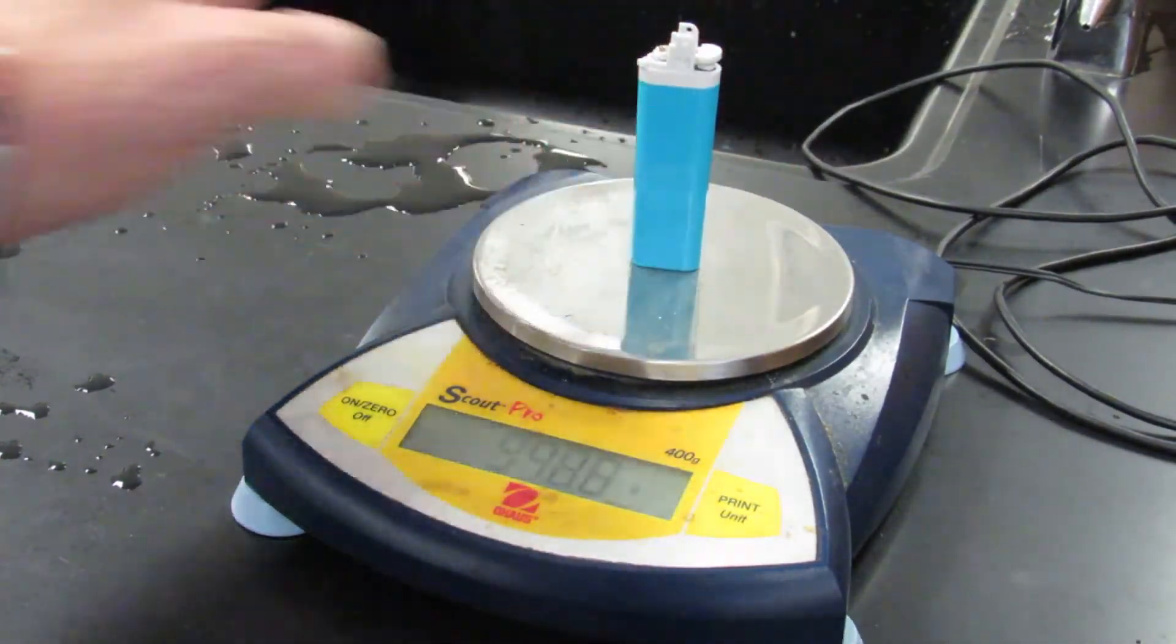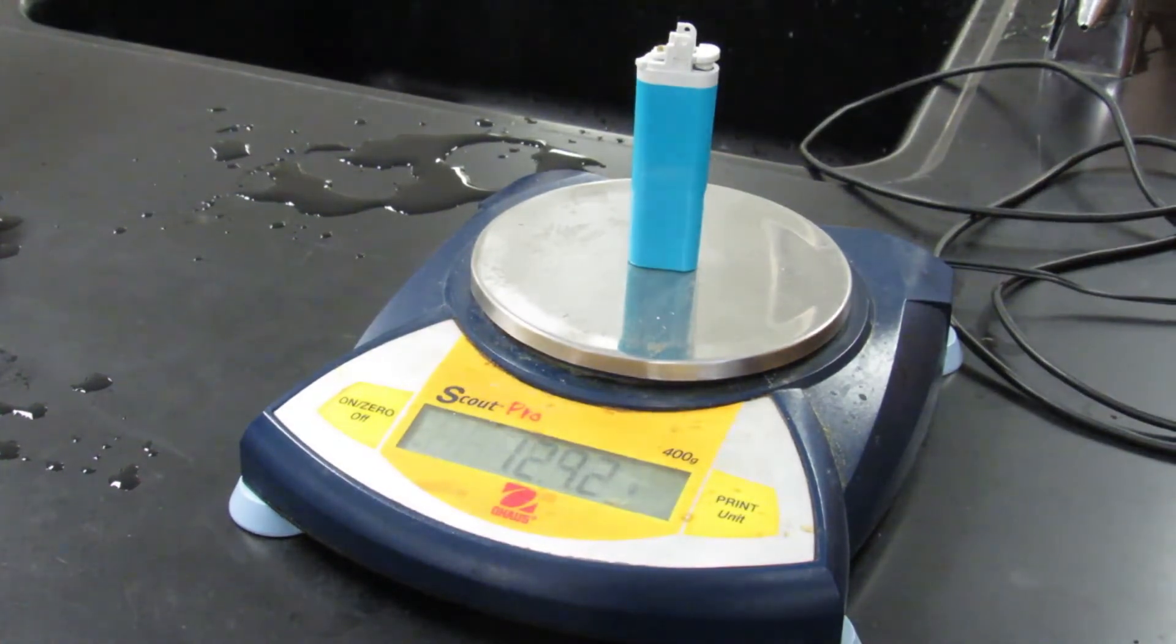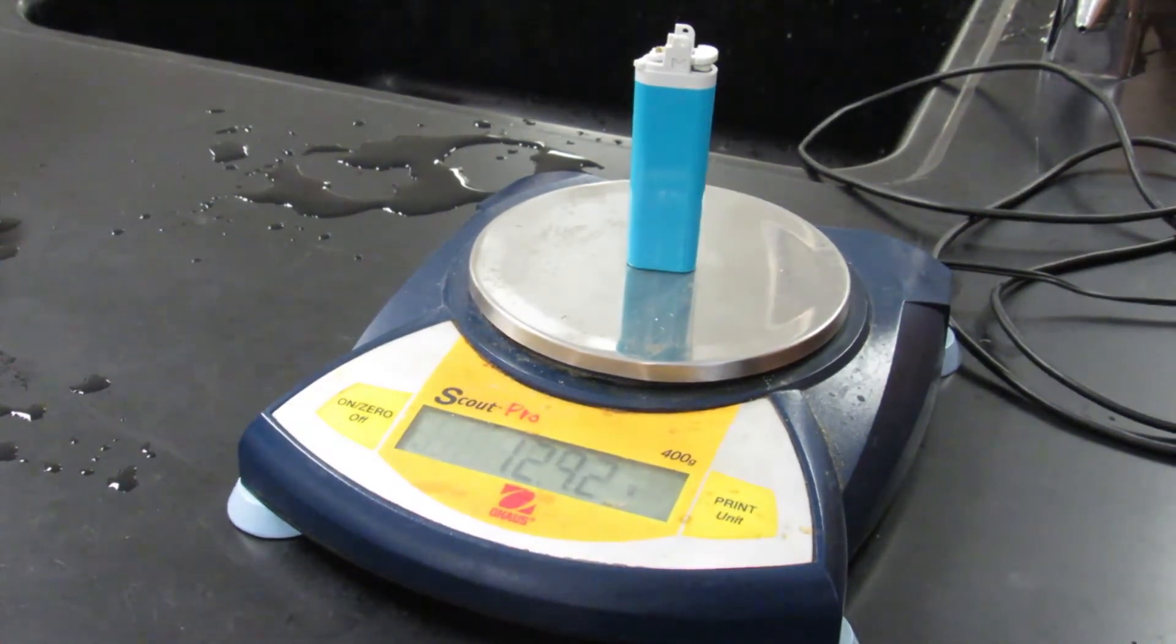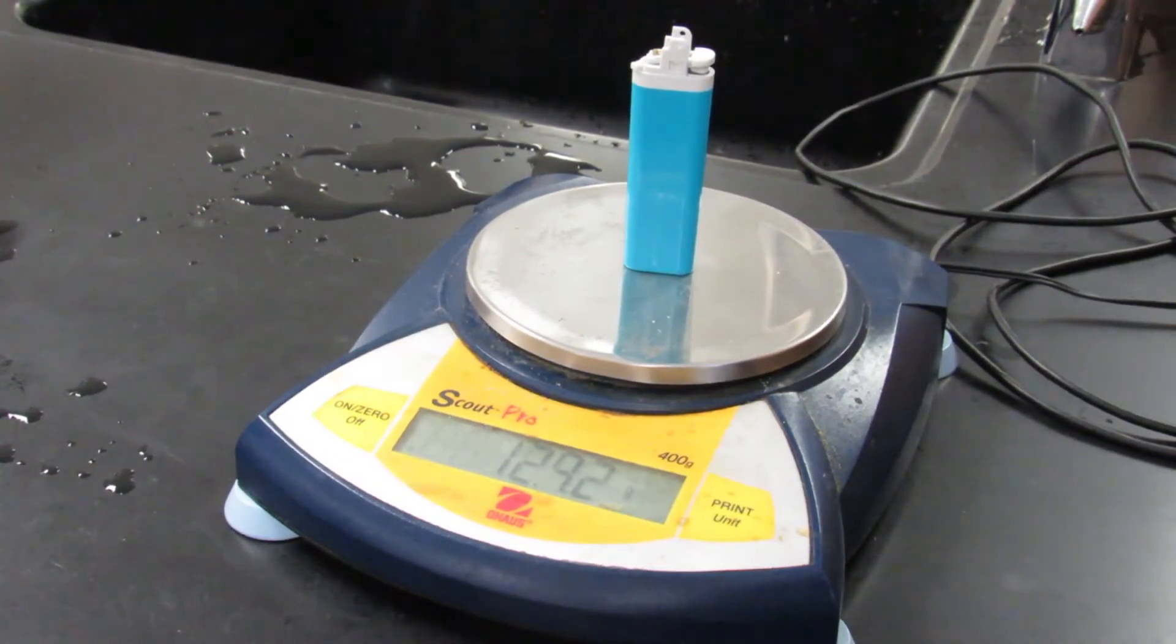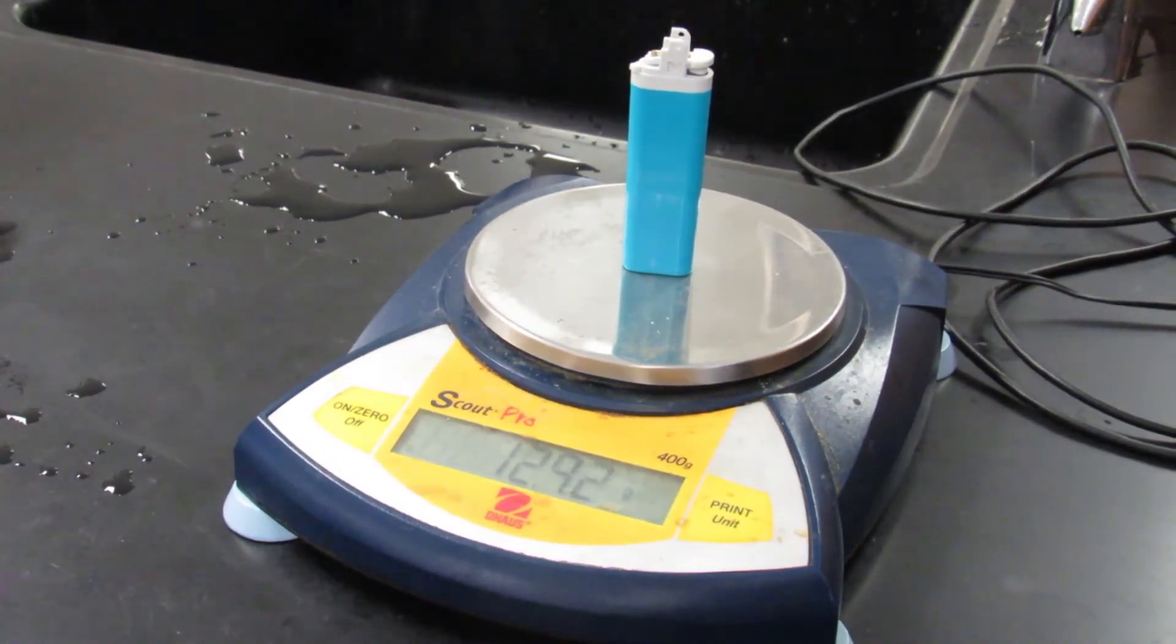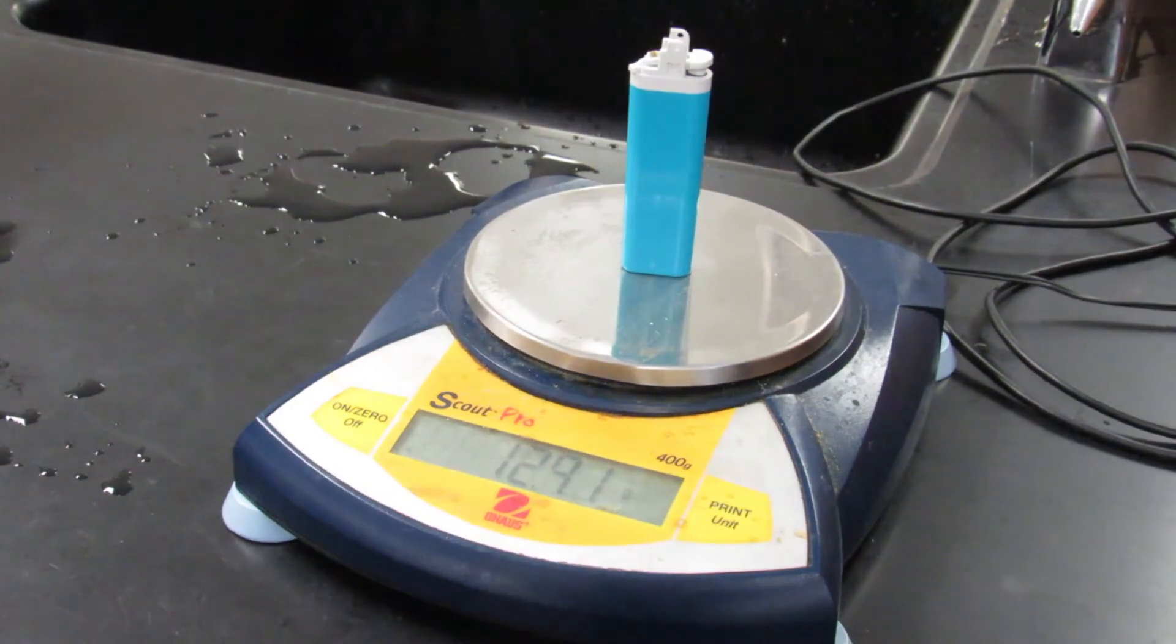It should get lighter if I can make it stand up, and we have a mass of 12.92 grams. So we lost about 0.24 grams of gas.